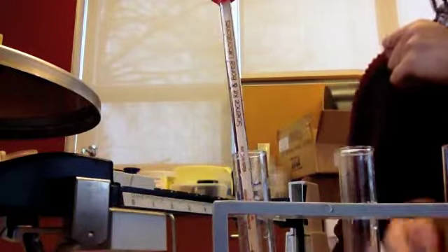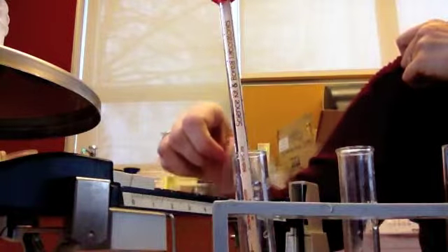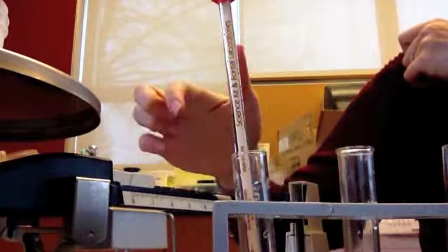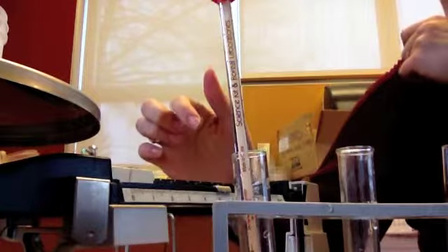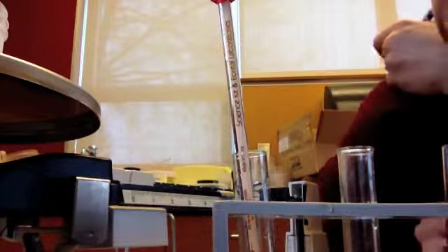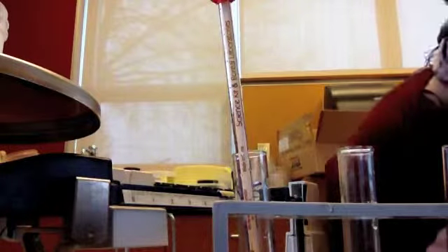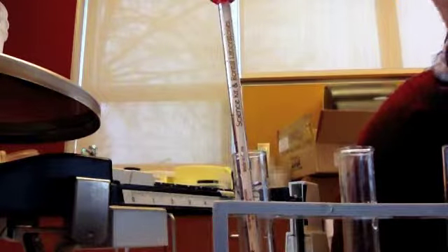And we need to mass our sugar jar again so we know how much sugar was added. What we're looking for is the amount of grams that was added, not the amount of scoops. Using grams is always more precise than saying how many scoops, because they added it in little scoops, but we're more concerned about the mass. And it looks like we're at 35.7. So you started at 37 grams and ended at 35.7.